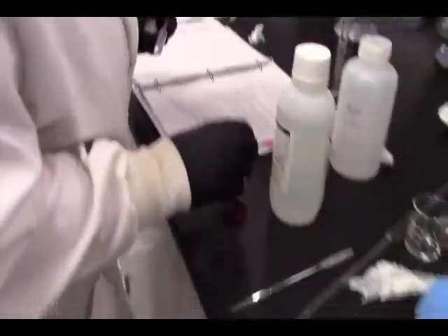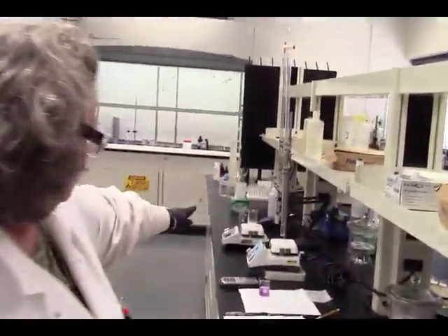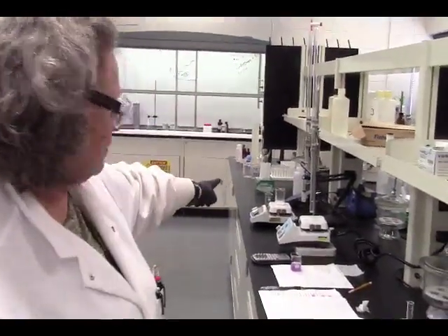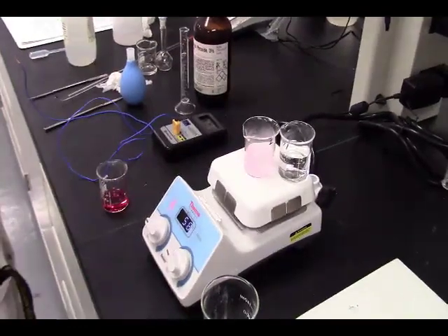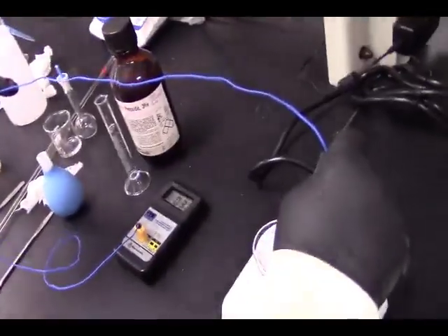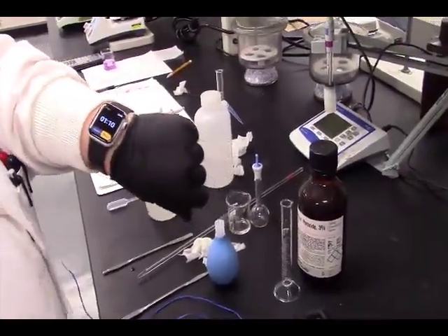Okay. Now what I'm going to do is, once we're boiling from that solution, for the amount of time that we need to boil it, I'm just going to remove that from that hot plate and put it on this hot plate since this is fairly cool. Turn off the heat and let it stir after this one's complete, which is going to take about that time. This solution is at 32 degrees. And we only have 1 minute left. We have 1 minute 13 seconds, so we're almost done with our first complex.